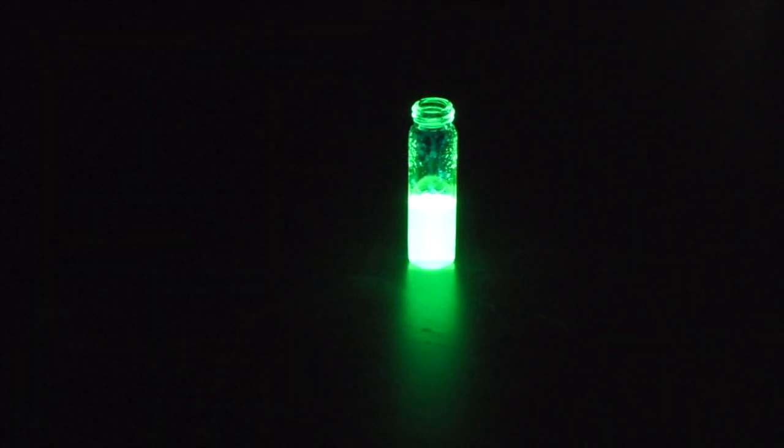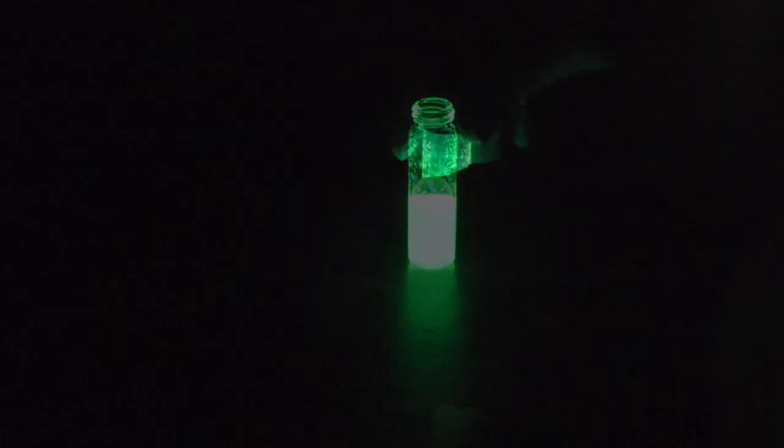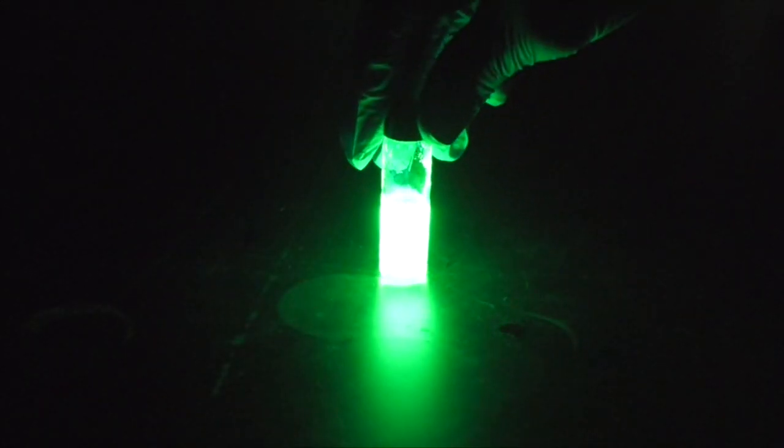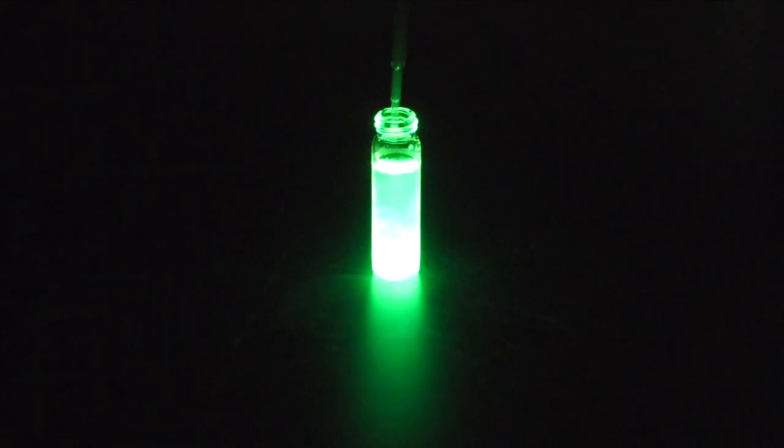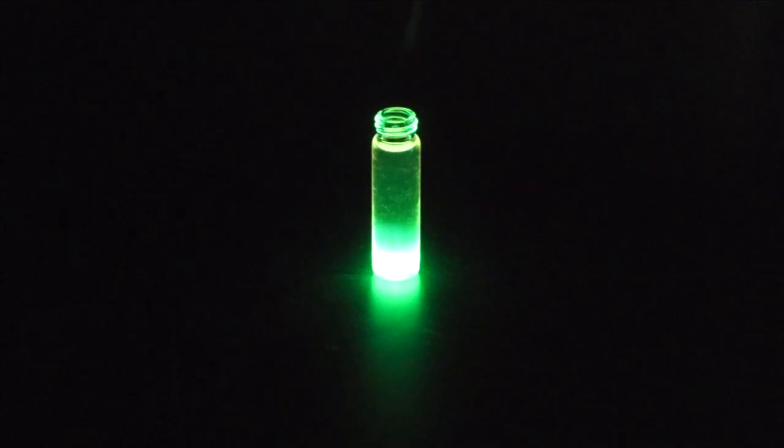Likewise, adding a few drops of an alkaline solution to this glowing liquid can make it glow brighter. But adding too much of the alkaline solution will dim the glowing liquid. In this case, adding less of a chemical is better.